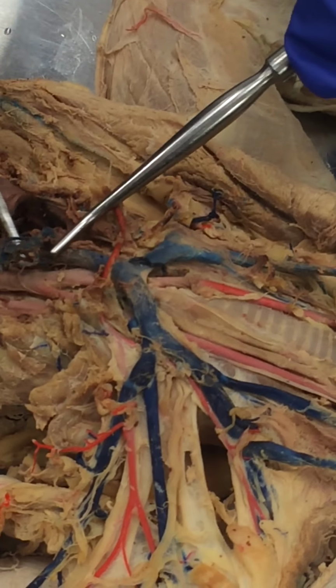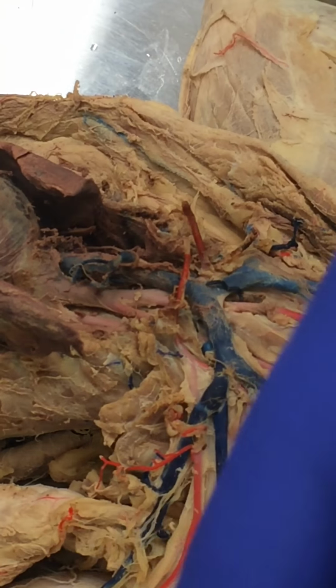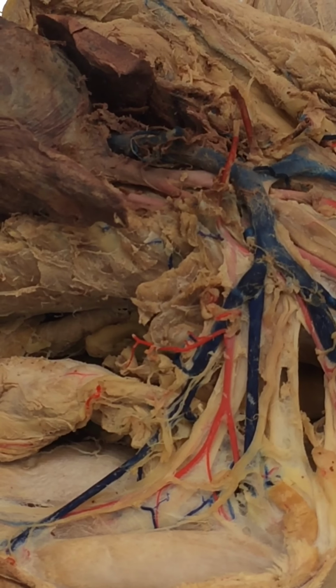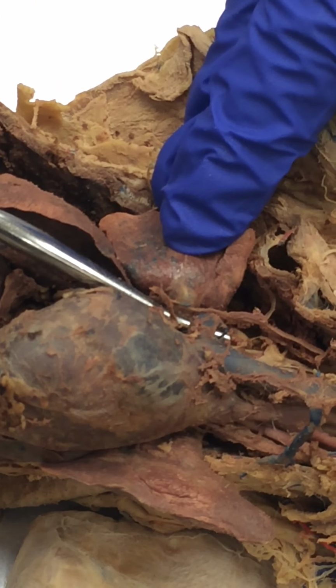artery, and then of course this is the internal mammary vein, right? And this is the superior vena cava, and this one actually has two internal mammaries. You see, there's one, this one, the other one disappeared somewhere. Oh no, there it is. Well, it goes down there, but there's one of them, and this one's got the two. Internal mammary artery, and then superior vena cava, and then down here you might want to see it right there. You see, azygos vein.